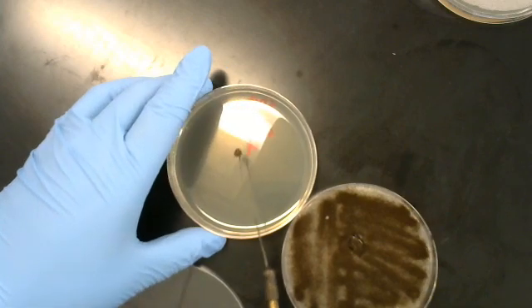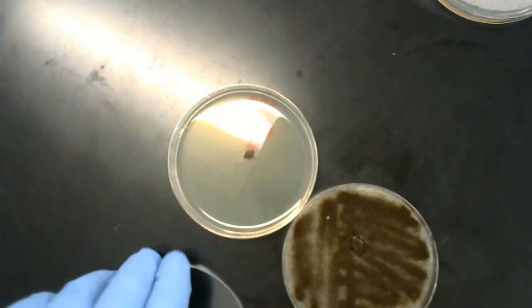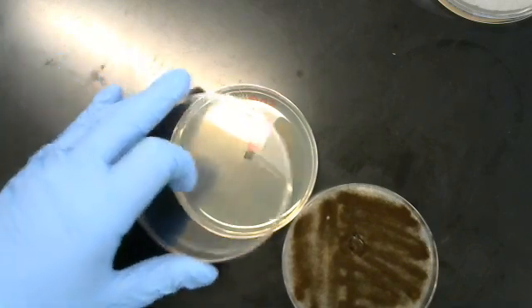And then transfer that over to the plate like that. Sterilize the loop.